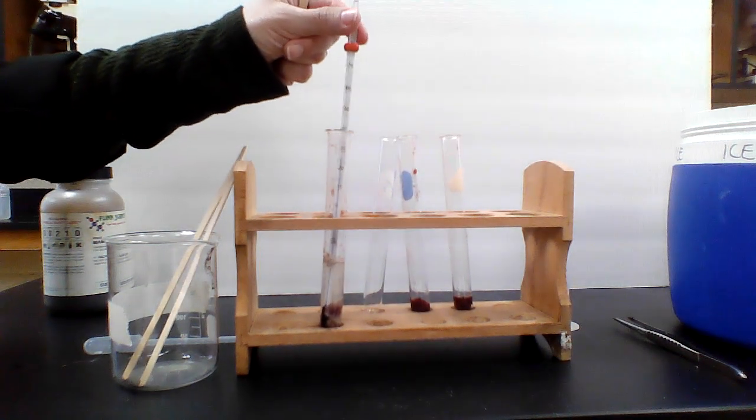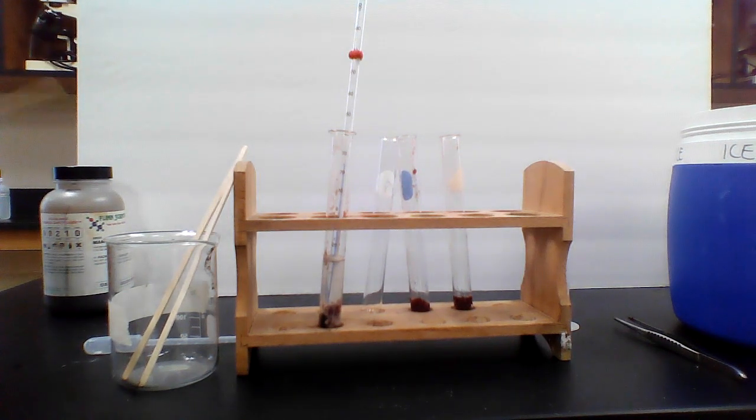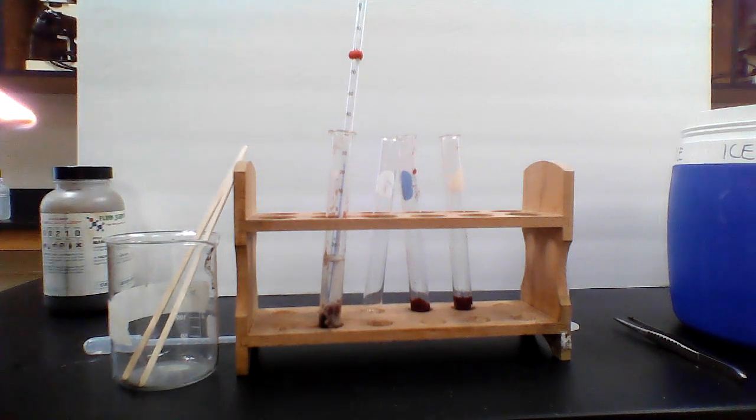So we're going to give it a 1 for bubbles, and a temperature, boy, it doesn't even look like the temperature's going up. Maybe a 20, yeah, I'm going to still say a 26, I think. I don't think the temperature increased at all.